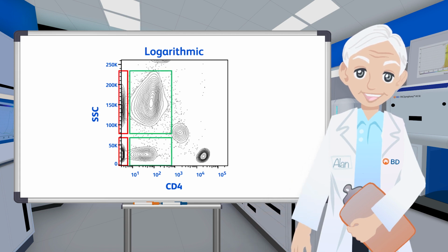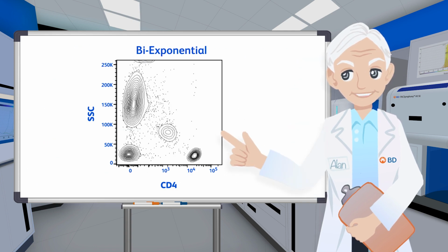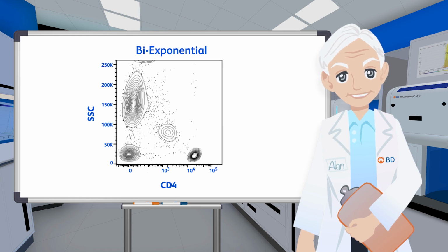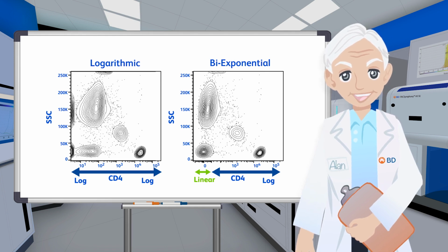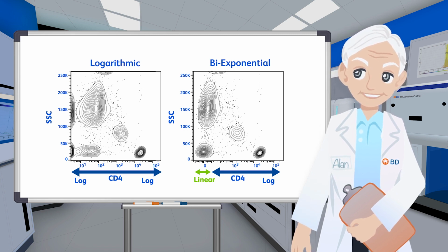This can result in single populations actually appearing as two distinct populations, as seen in this plot shown in the red and green boxes. This problem can be mitigated by scaling methods such as biexponential, which combines the best characteristics of both linear and log into a single scale. As seen here, higher values are in a log scale, but as they approach 0, the scale shifts to linear around 0. Values significantly below 0 shift back from linear to log. There are a number of mathematical variations of this combined scale, such as biexponential or logicle. Using the data shown earlier, we can see that when plotted in biexponential, what appears to be two populations are in fact one.